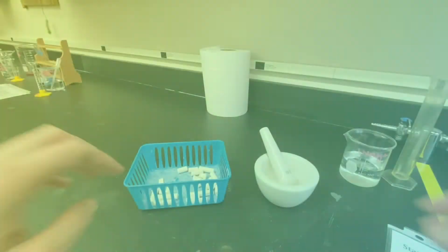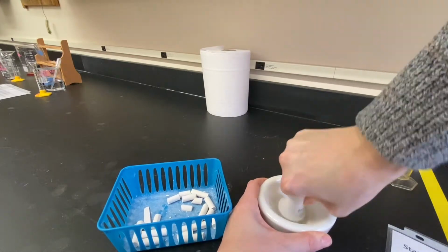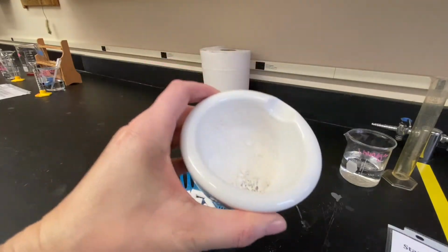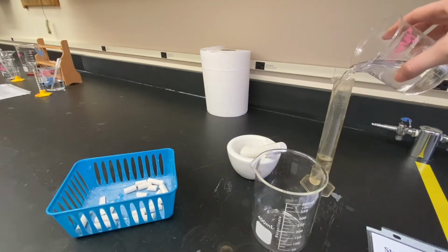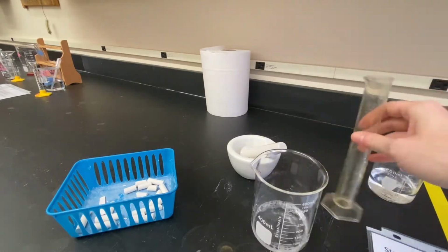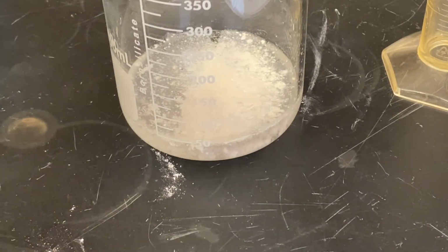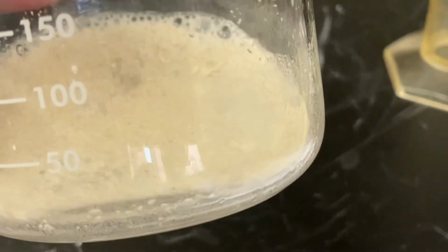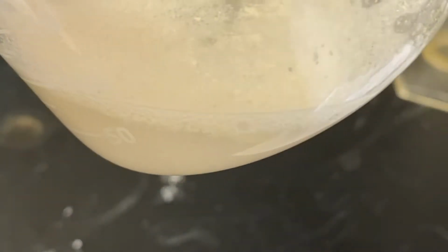Station 4, there's 2 parts here. The first part, I'm getting a piece of chalk. I'm gonna start chopping it up, or grinding it up. As suspected, it is now powdery. And I'm gonna speed up this next step here. Getting about 50 milliliters of vinegar, adding it to our beaker, and dumping the chalk dust in there. So you should be able to hear some of those gas bubbles forming.